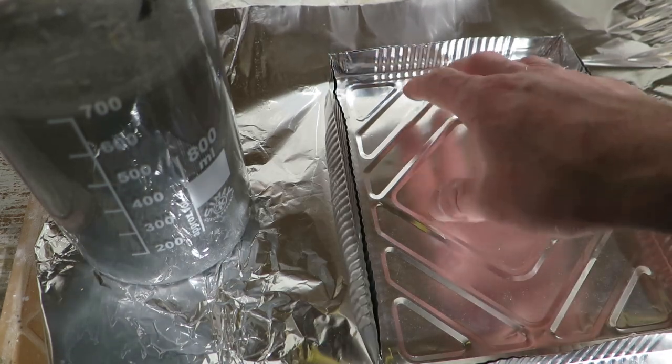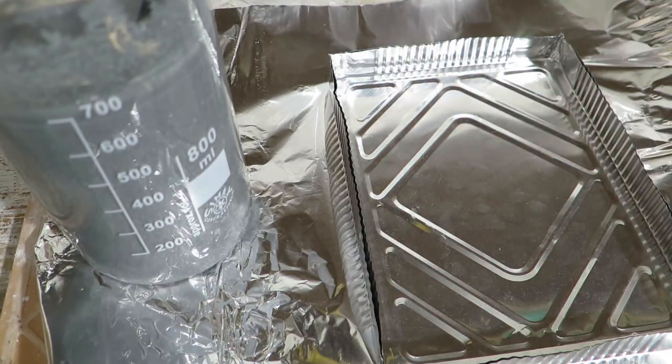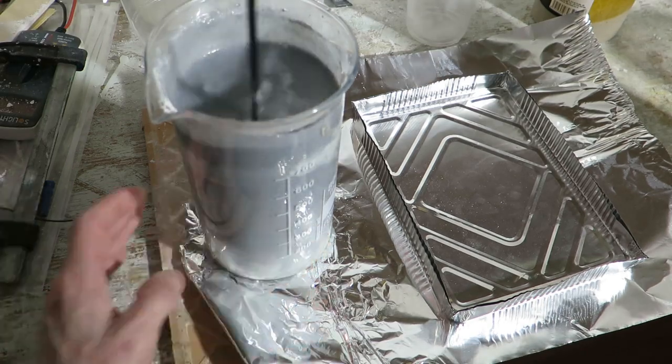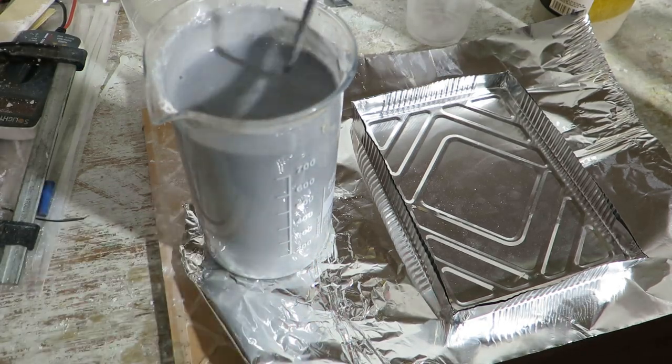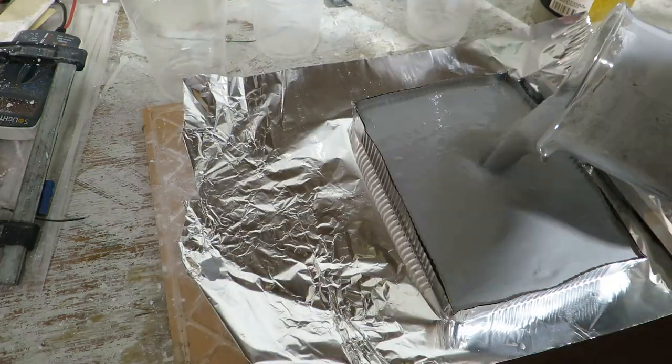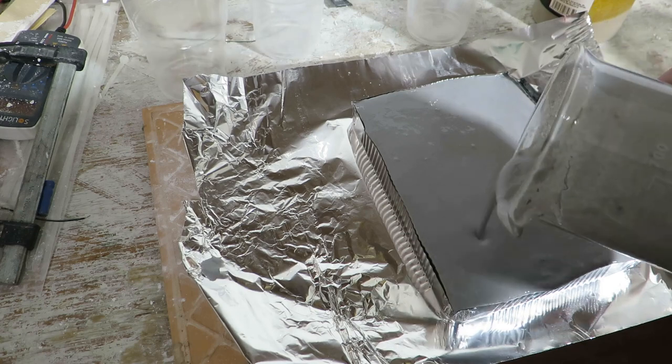And in the last step we will add some gypsum and glass fibre. I would recommend using gypsum as quickly setting as possible because it will be extremely diluted and well, if you leave it sitting there for too long it will settle on the bottom and it will not be good.